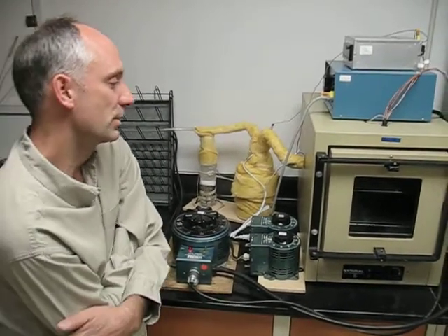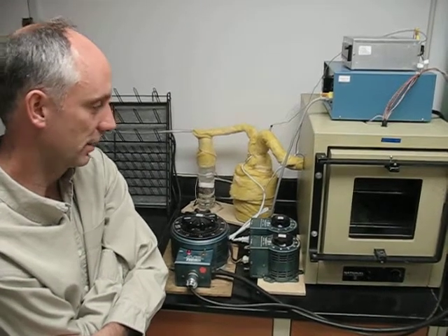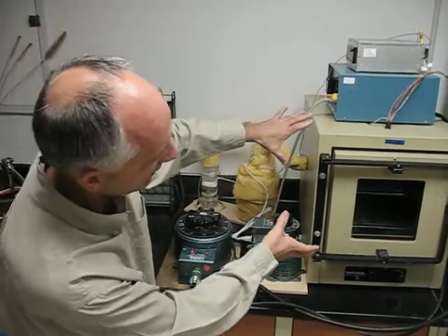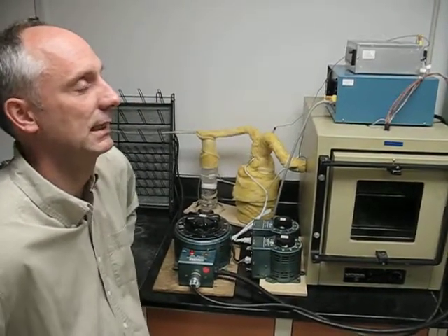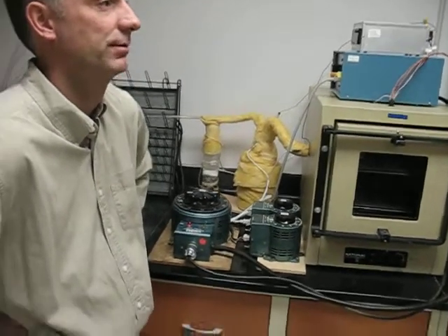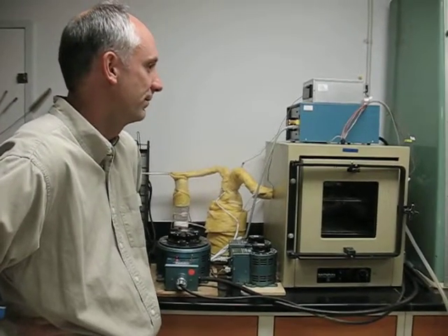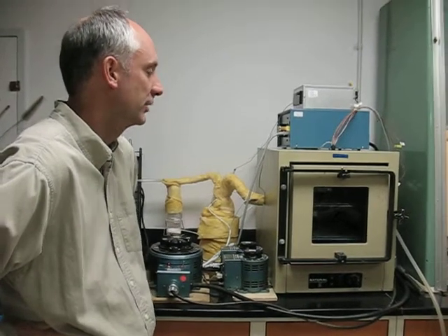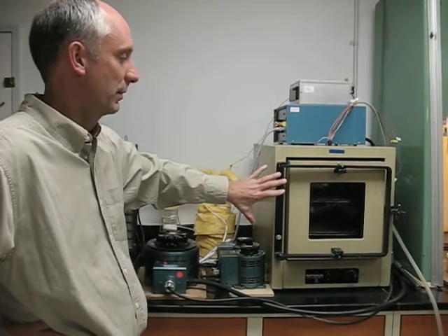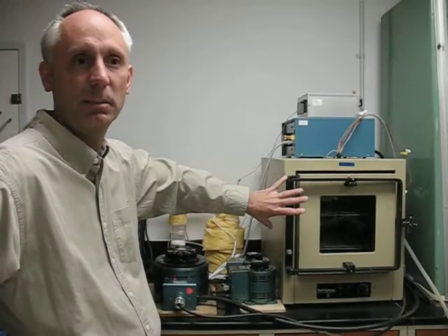The flow rates that we're using, if we assume an exponential dilution of the volume of air in the incubator, which I believe when it's full of the samples and bottles, we've calculated to be about 45 liters, and so there's a 95% air exchange every 10 to 15 minutes.